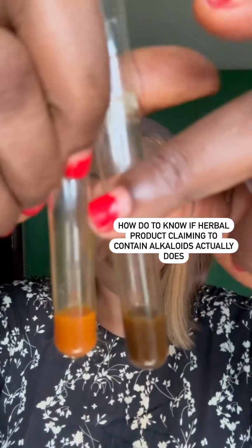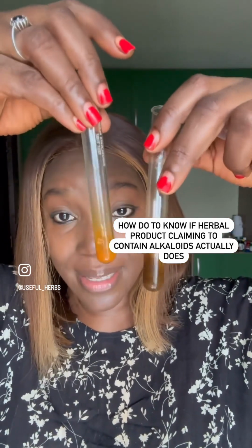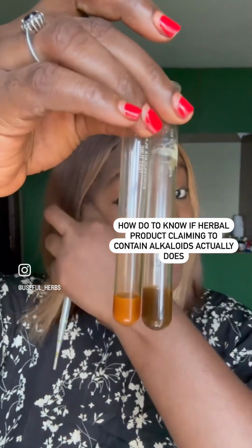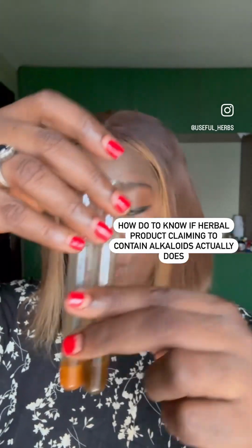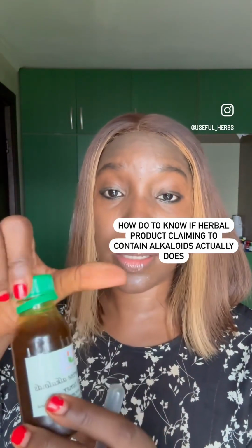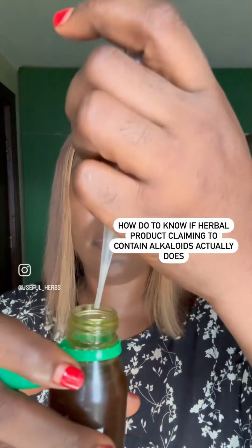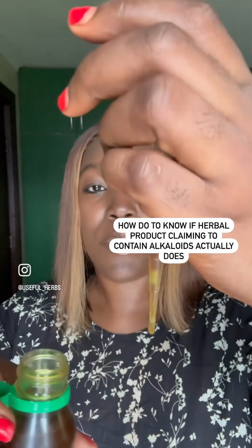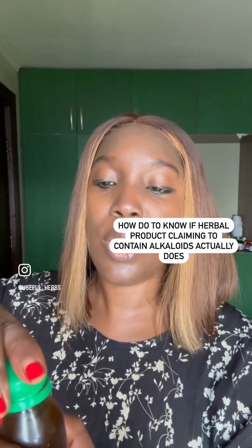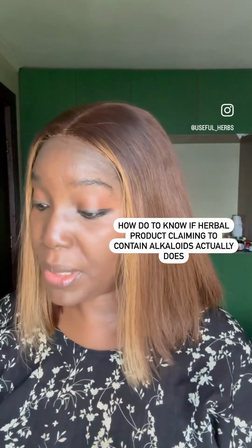I left it for a while so you can see there are different colors. I'm going to show you a comparison between the protoberberine, this one, and the one that we've added the reagent to, because you may not be able to see the difference except if I put them side by side.